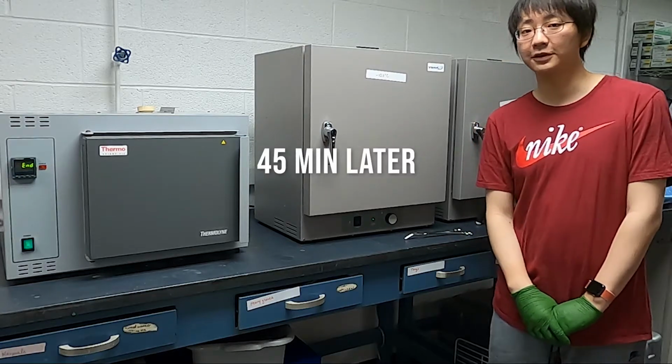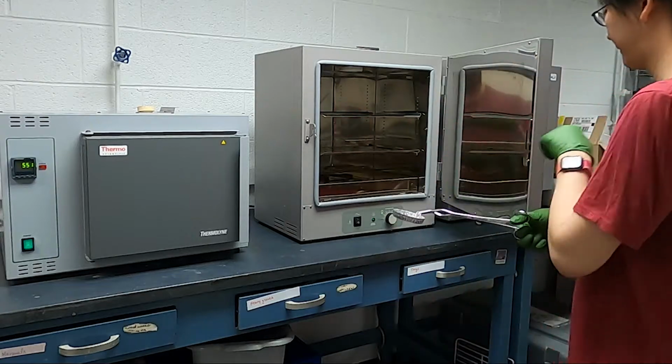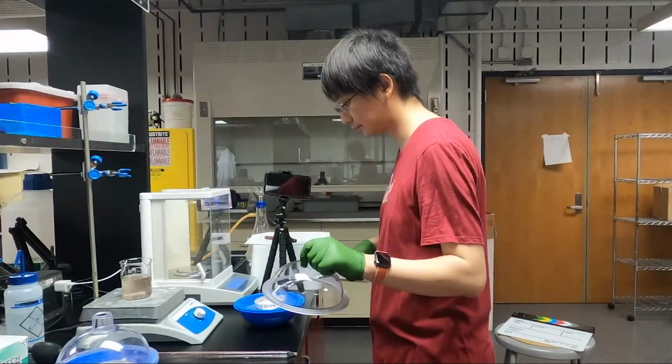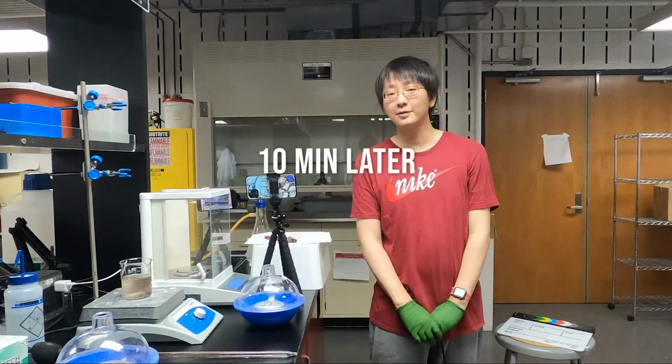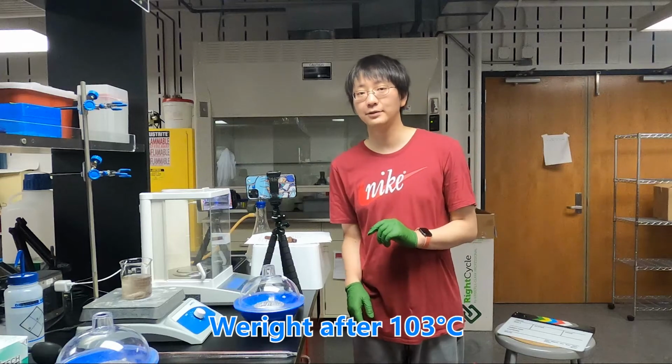So now it is after 45 minutes, and then we are going to take the sample out. And then after 10 minutes, we are going to measure the weight of the aluminum plate with the filter.